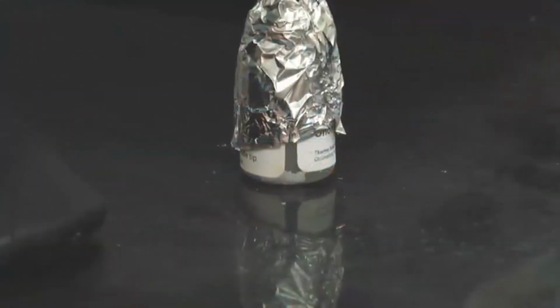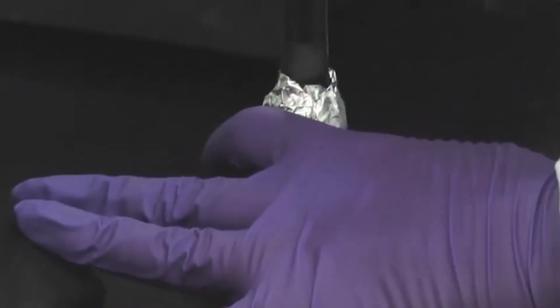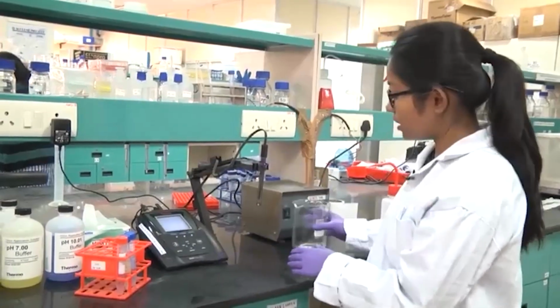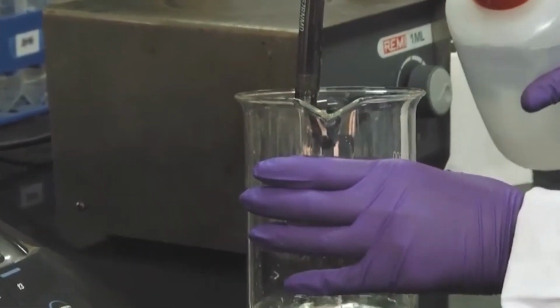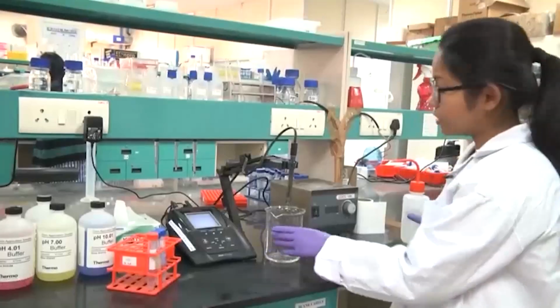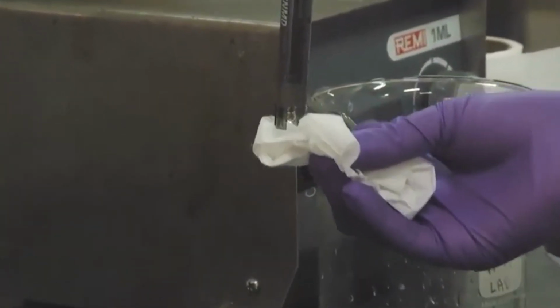In order to do the pH meter calibration, first I will take out the probe from the storing solution, and as I mentioned earlier, before you dip the probe in any solution, you have to wash it thoroughly with deionized water. While washing, do not damage the probe, always use deionized water. After you wash the probe, dab it with a clean tissue paper. Do not rub the probe, otherwise you might damage it, as it is very sensitive and fragile.